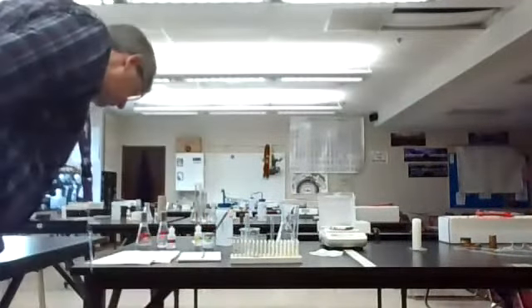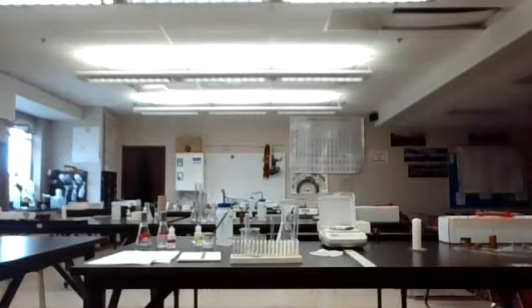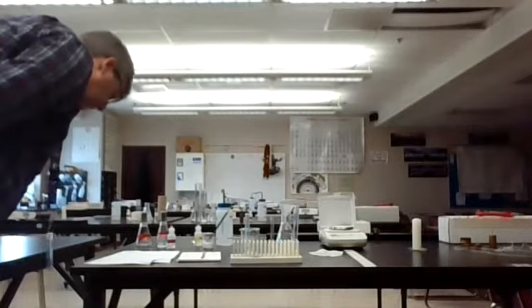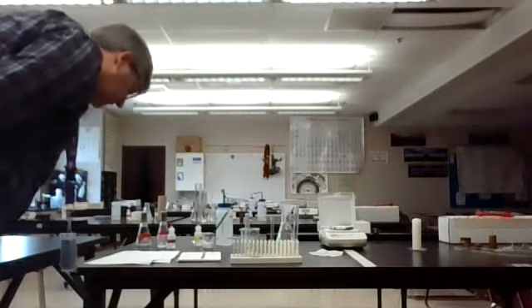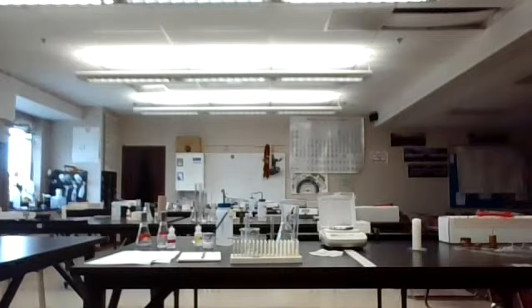Excuse me. So what you're supposed to do now with this is upload this experiment to Notability. Okay, then you go ahead and obviously you've watched this through. For each of the parts of this experiment, I want you to determine whether you have physical or chemical changes going on. To give you hints about that, think about, could I put it back to how it was pretty easily, with not a lot of effort, without a lot of energy?